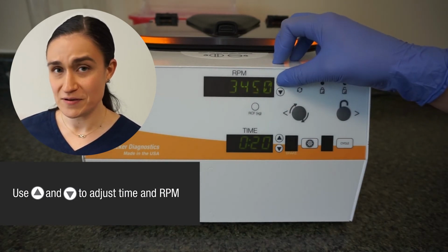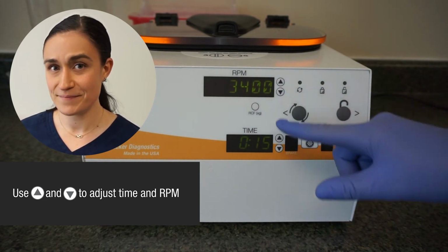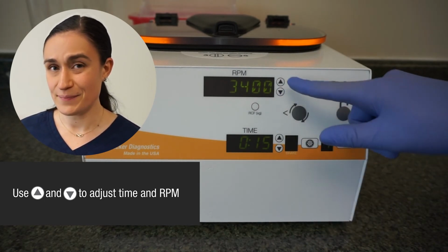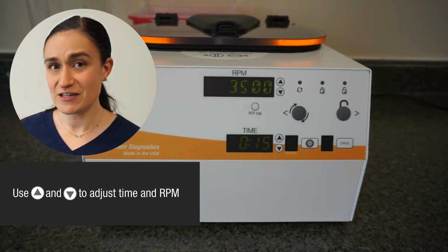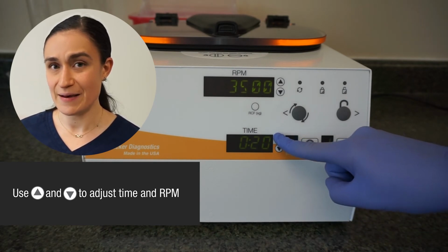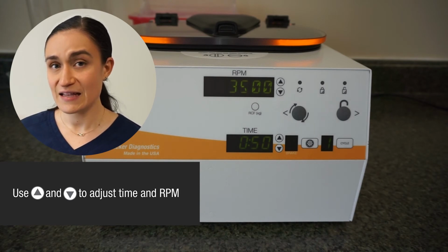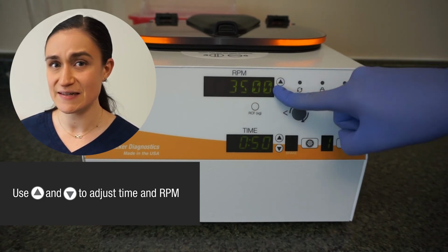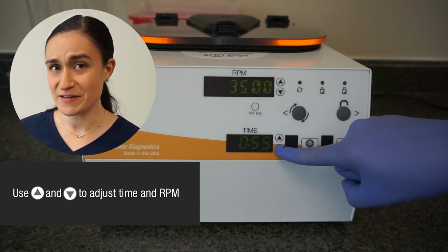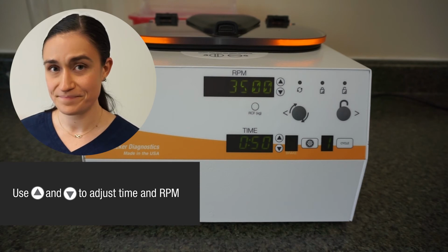We're going to control those with the same buttons that we used to set them initially, the ones right next to the display. So we're going to change our RPM by pressing the up button next to it once, twice, and we're going to change our time by pressing the up buttons next to it until it adjusts from 15 to 50. And keep in mind, if I were to exceed my target value for either of these, I could use the down button to reduce it. Similarly, I could use the down button to reduce from the original. I can control these the same way that I did when I was originally setting them.